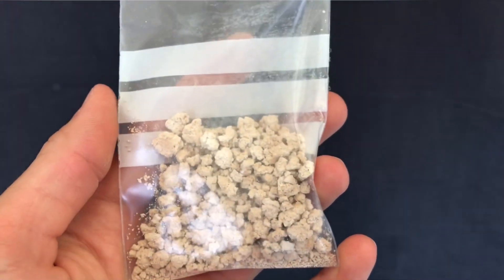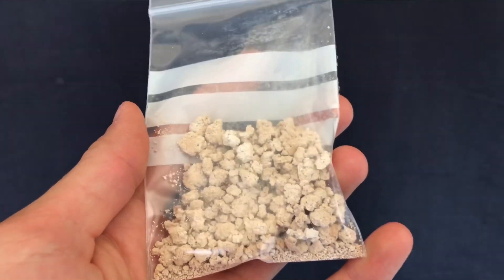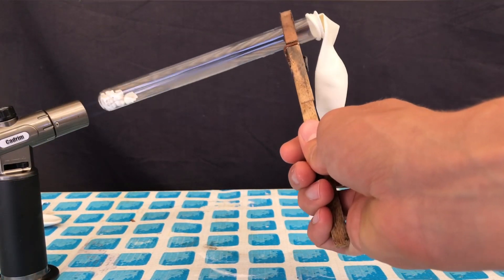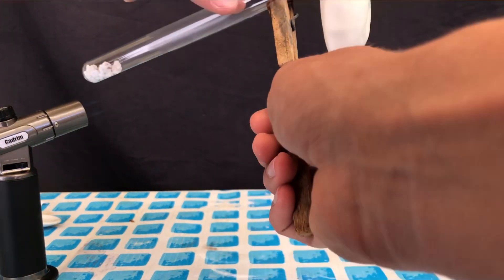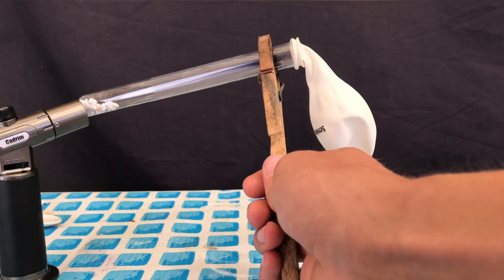I didn't want to decompose the product and I'm going to accept that there's still a bit of moisture in there. We ended up with 15 grams of product and I didn't even calculate the yields because it's low, probably lower than 20%.